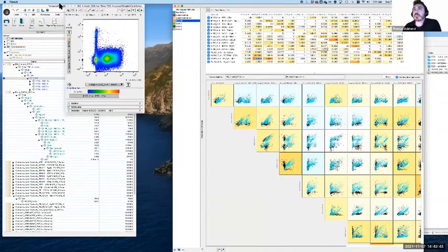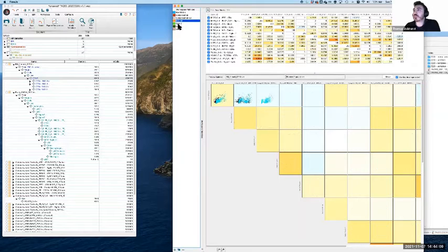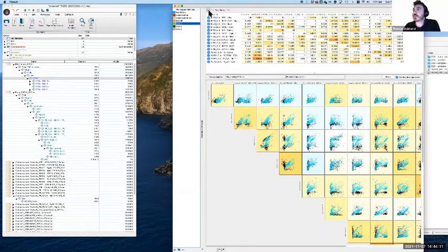All right, so let's dive into one of our cases. I've got my notes here so I can remember what the pairs are. What I've done is, I've fabricated it: I've deliberately entered some compensation errors. So we're going to apply a few of those errors, go hunting, see what we can find, and then follow a method which we can use to help us understand, can we correct it and can we do it reliably? To do that, I've got this compensation matrix here. I'm going to drag it and apply it to the samples.